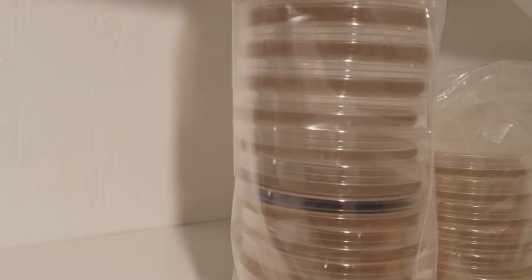And Alex, sorry man, I've been a little delayed — I got your order here, talked about this in the last video. So I'm going to be doing all of these cultures today. Basically, I store my Petri dishes up to a couple months. I have noticed that one of our Petri dishes has contaminated with black mold. These dishes have been sitting up here for two months, so I'm going to be really careful. I'll cut the plastic, set aside the good Petri dishes, and put the one with black mold aside. As long as there's no mold on the outside of the dish and it's just contained, the other dishes are going to be fine. This happens from time to time, especially because we store them for a long time.